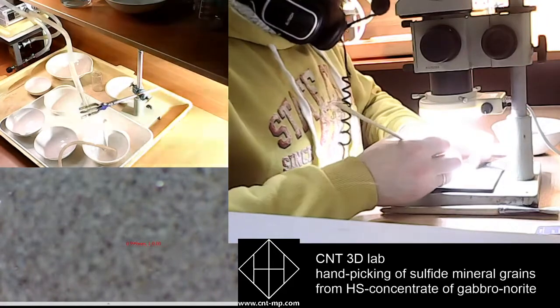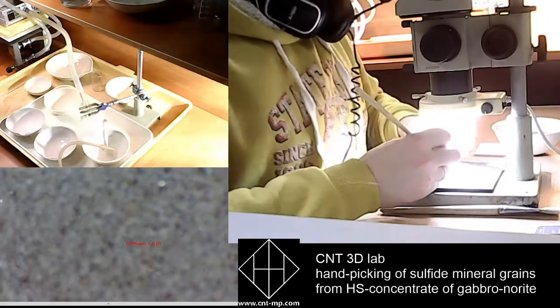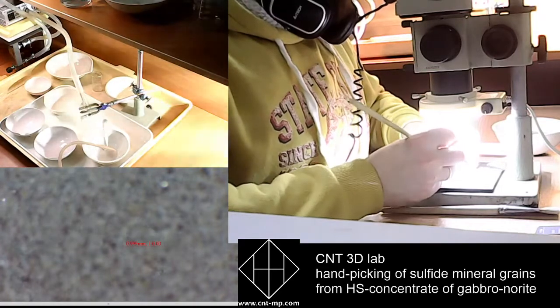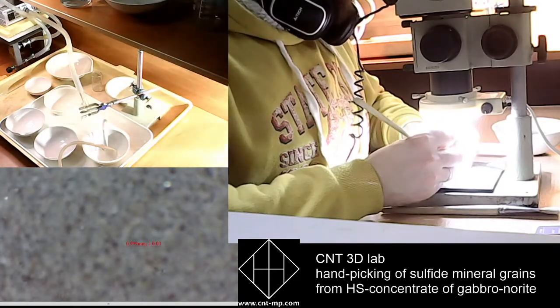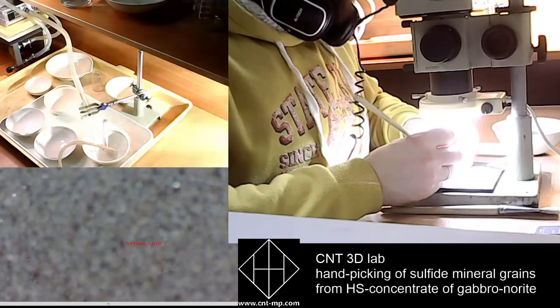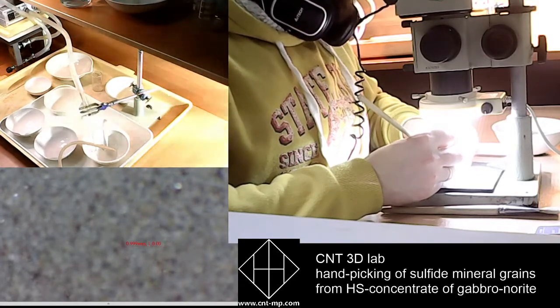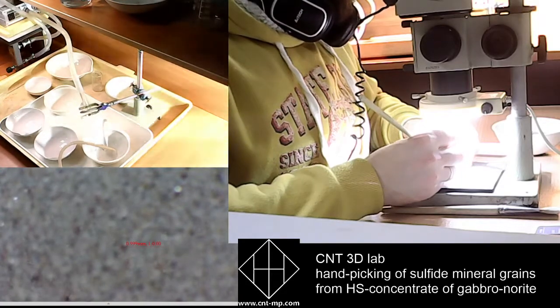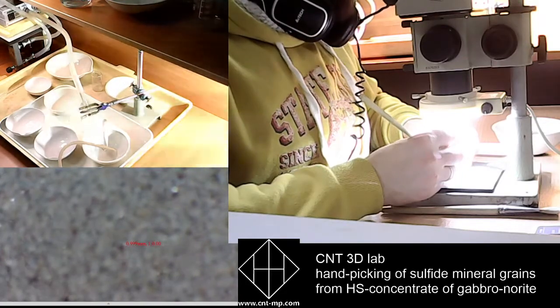So for this current case, we are looking for at least 50 grains of sulfide, as it would be enough for isotope analysis.